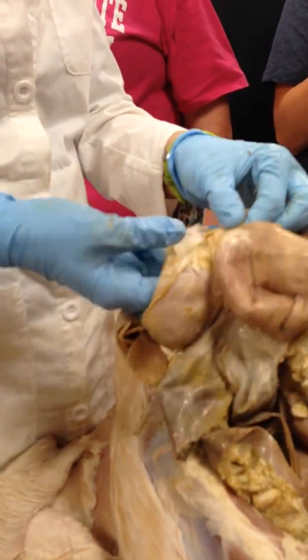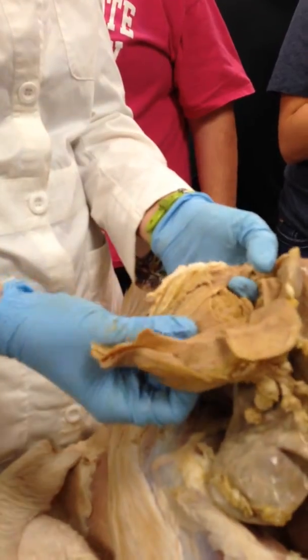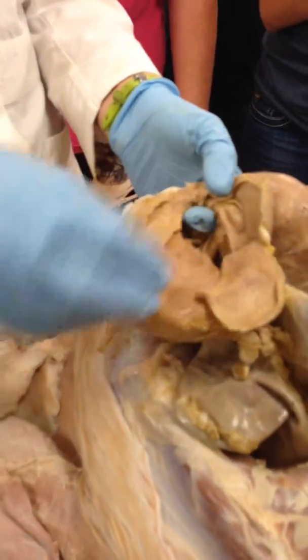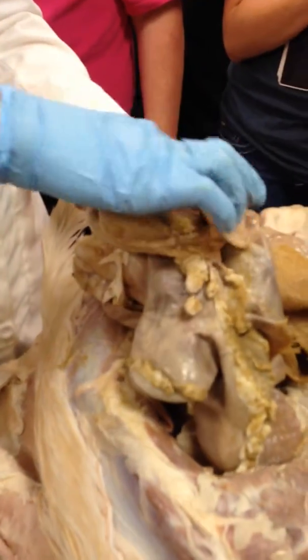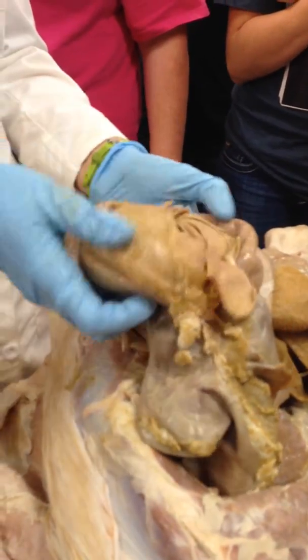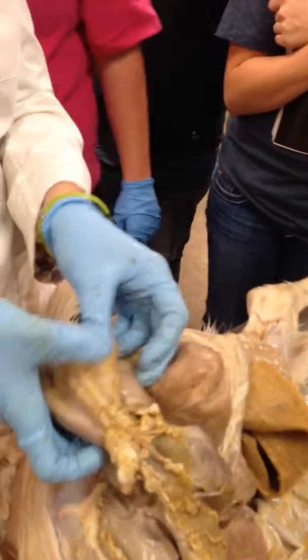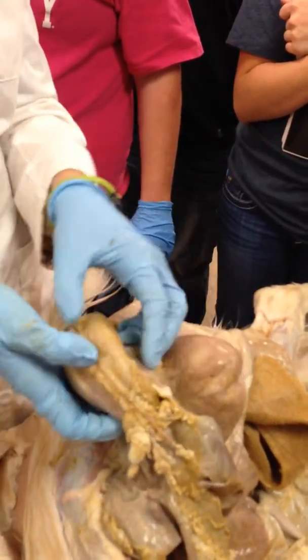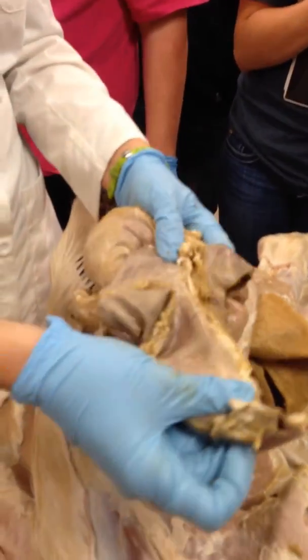Once it leaves the reticulum, it goes into the omasum here. The omasum is what we call the butcher's Bible. So it has a page-like appearance that again is used to increase surface area. So butcher's Bible is the omasum. If it's intact, it's usually the more bulky part of the stomach because it's got all of this stuff in the middle. Then we run into the true stomach, which is called the abomasum.